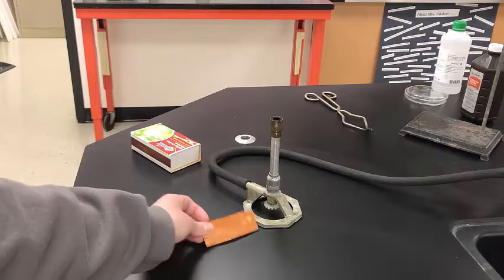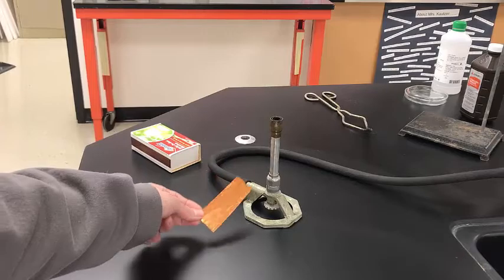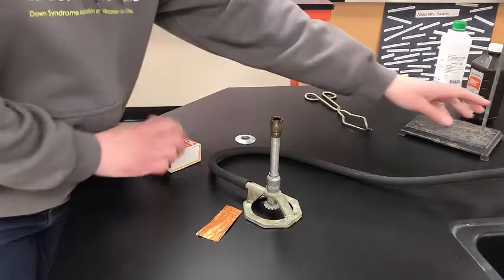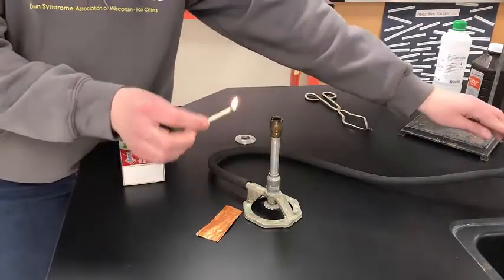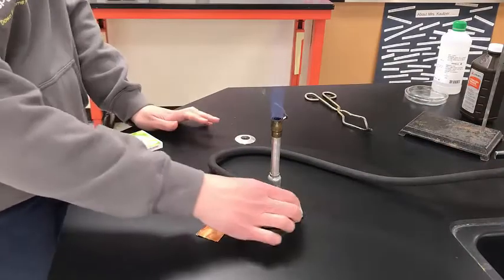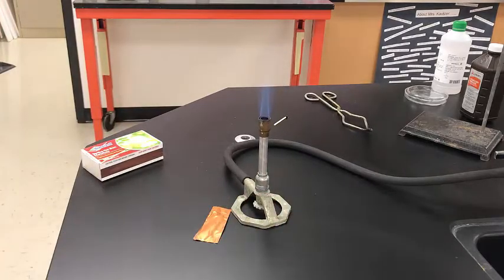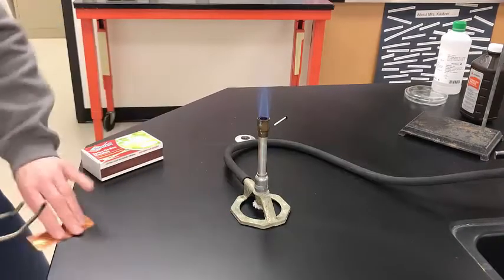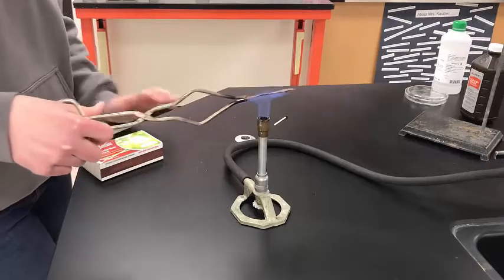All right, so you can look at the copper before the reaction. You see it's shiny, okay, copper colored, kind of that orangey color. So we're going to heat it in the Bunsen burner flame. So light my Bunsen burner here. I'm very sad you guys aren't here to play with the Bunsen burners. Okay, light my Bunsen burner, adjust it so that I have that nice blue cone. Okay, nice blue cone. Okay, and I'm going to take my piece of copper metal here, and I'm going to heat it in my Bunsen burner flames.